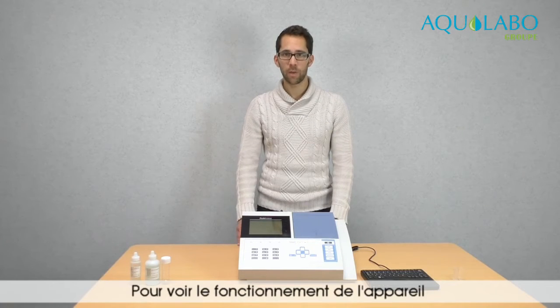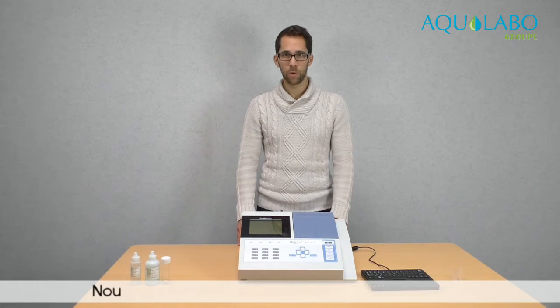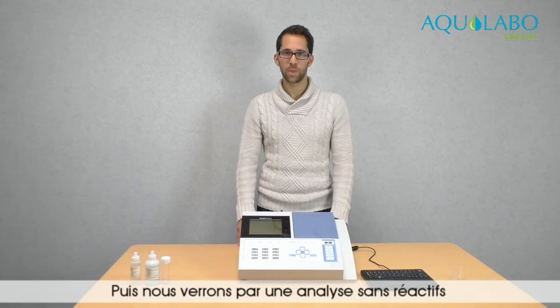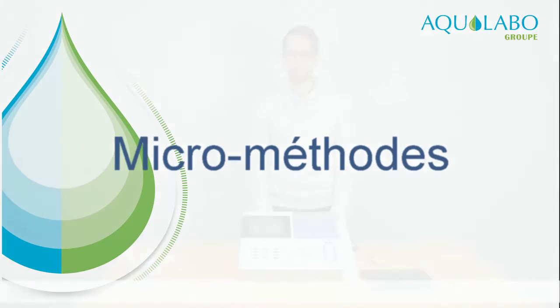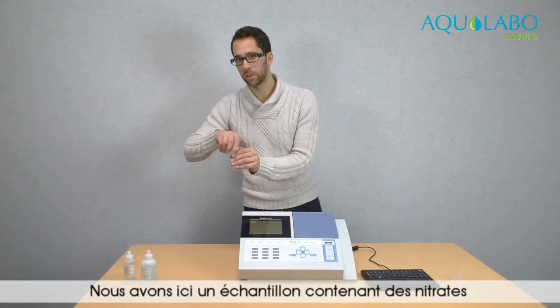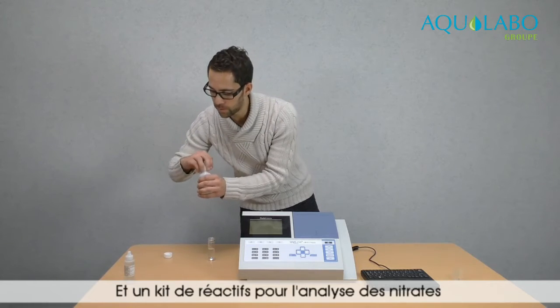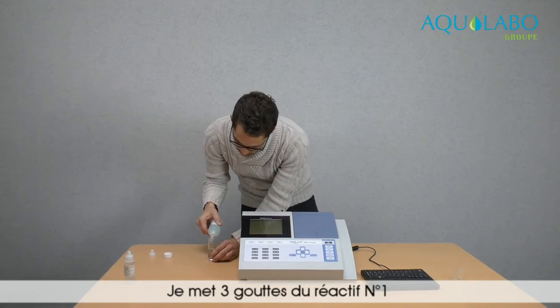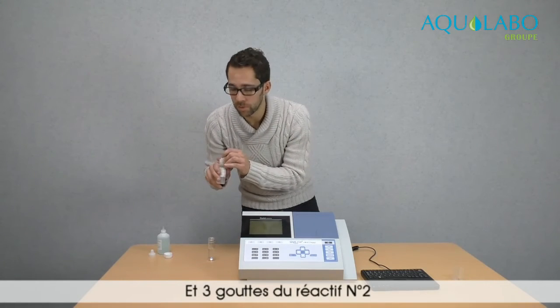To see the functioning of the device, we will conduct analysis of nitrates. So first we will make the analysis with reagents, then we will see the analysis without reagents. Here is a sample of water containing nitrates, and here is a kit of reagents for nitrates. I put 3 drops of the first reagent and 3 drops of the second reagent.